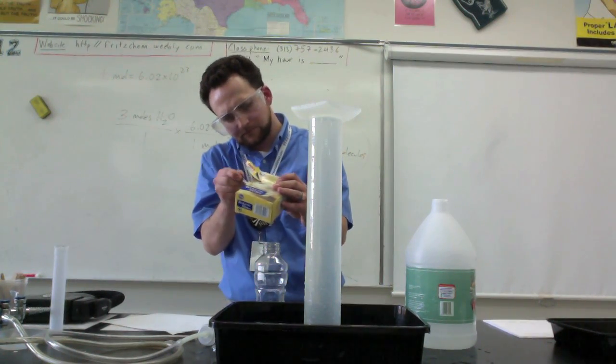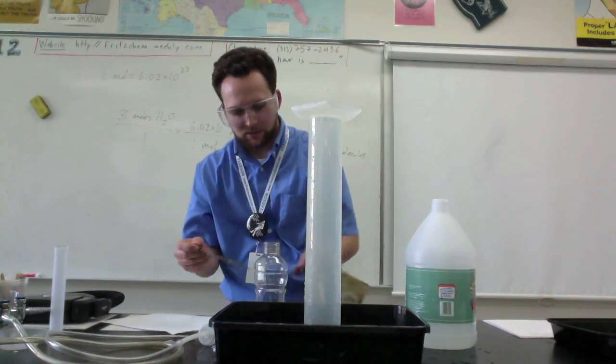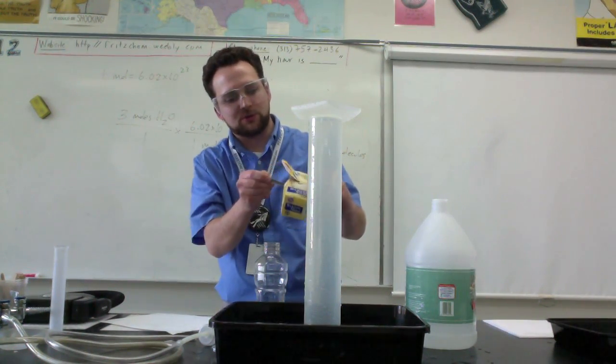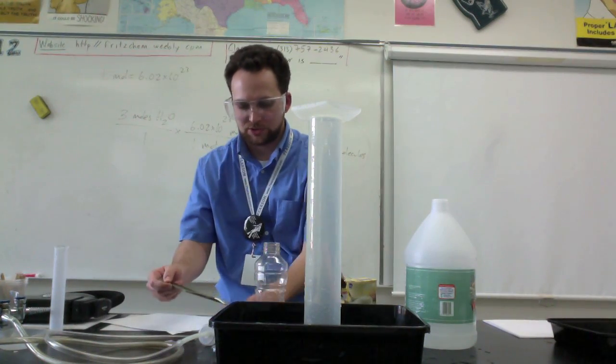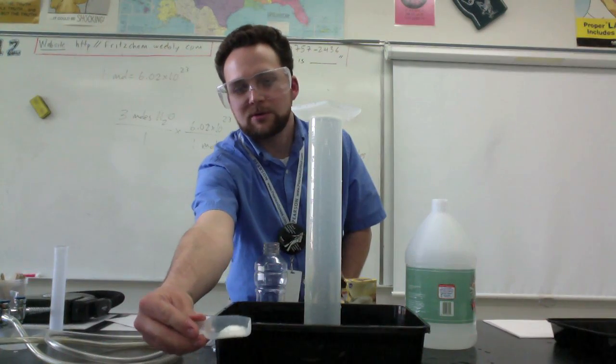I'm going to add some baking soda to this little boat first. When you do this, you can measure out a precise amount on a scale. I'm just doing this to show you the technique of how to collect the gas. So I've got my baking soda in there now, probably 3, 4, or 5 grams, something like that.